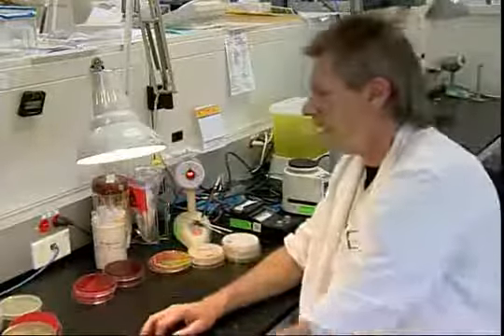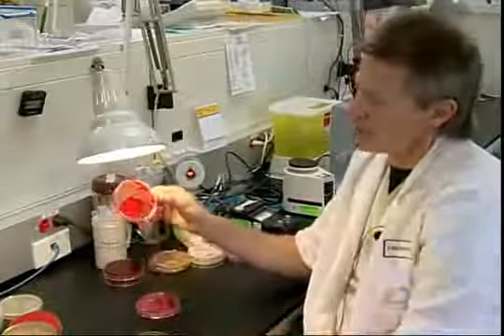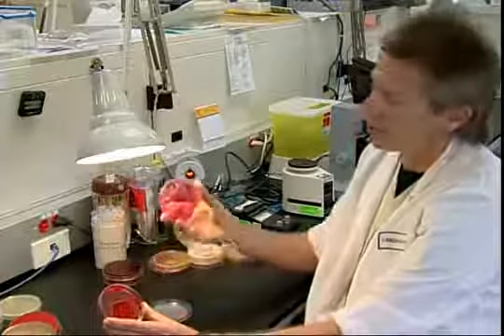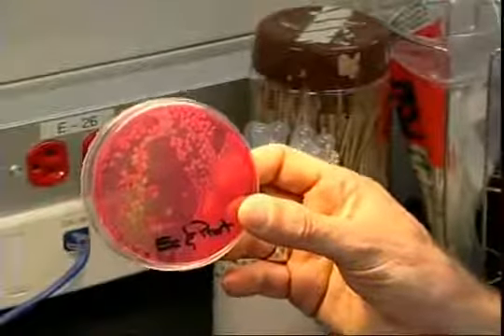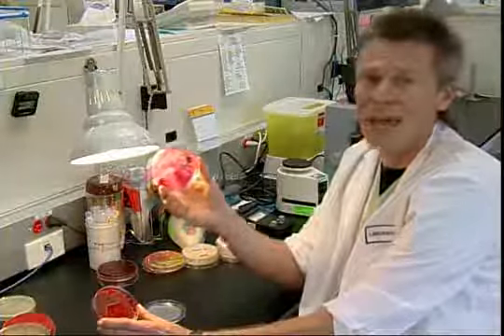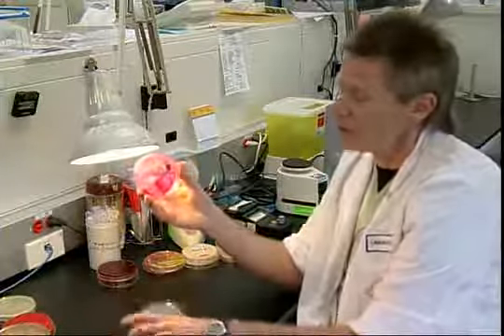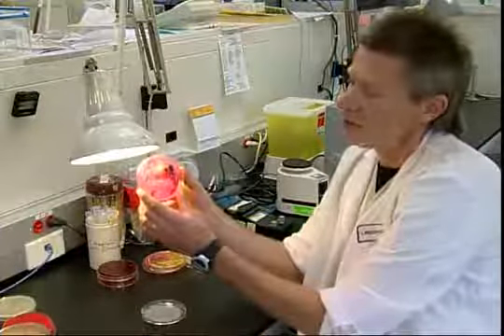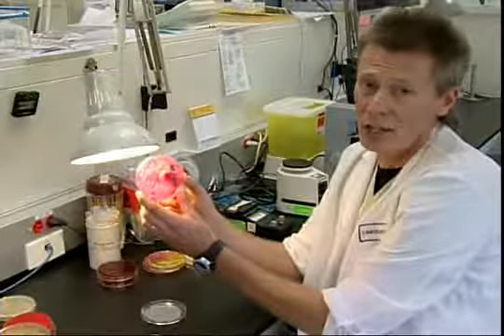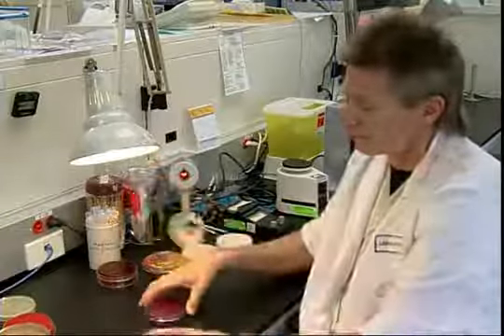Some plates are differential. If you look at this plate, you can't see much difference between the colonies. But because we use the MacConkey plate, the difference is a lot clearer. The MacConkey plate is a differential plate. It utilizes lactose to differentiate one bacteria from another. So here you see the pink colonies that are lactose fermenters, as opposed to the non-pink colonies that are non-lactose fermenters. And this is a good help in helping us identify bacteria.